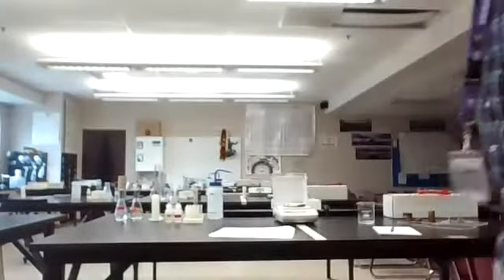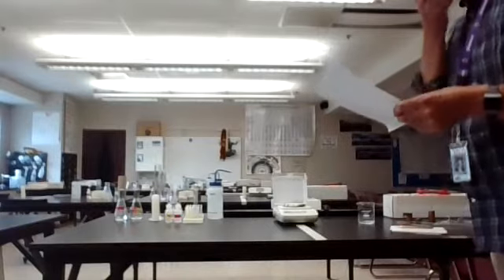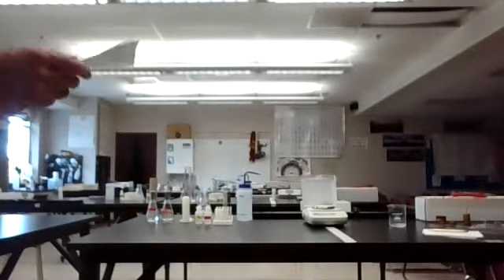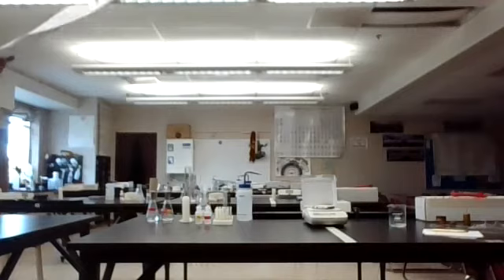Okay, guys, we are going to do this lab today. It's broken down into parts, and the changes refer to physical and chemical changes. We are just trying to do some observation into that. This experiment is broken down into 5 parts. I've actually already started one of the small parts of this lab, and it should go pretty well for us as far as that goes.